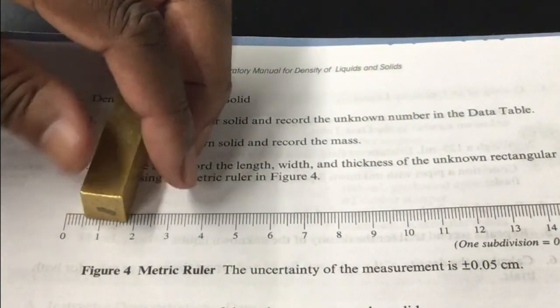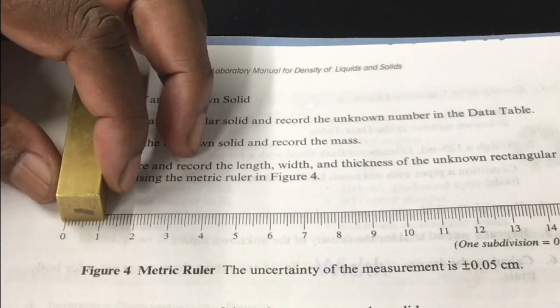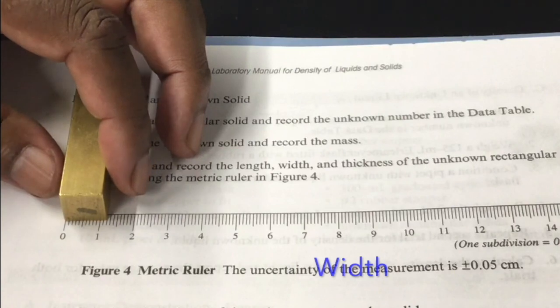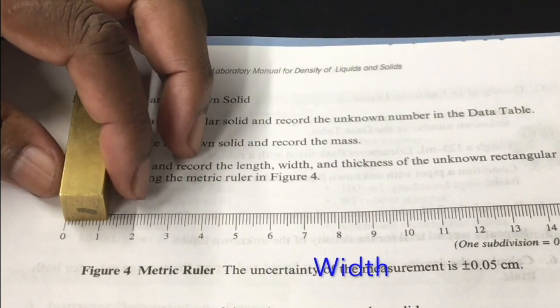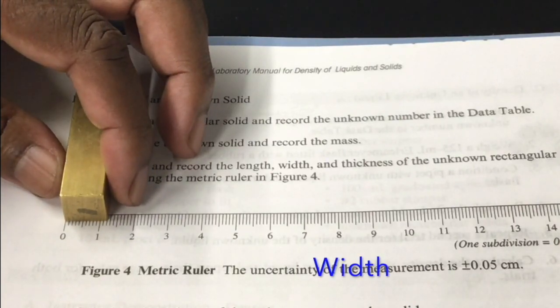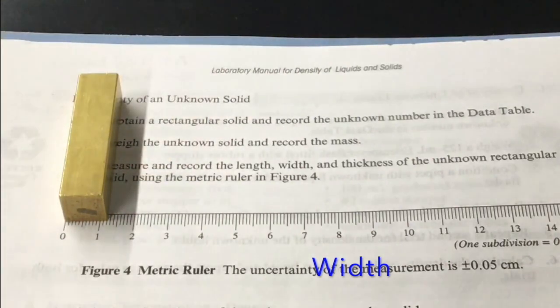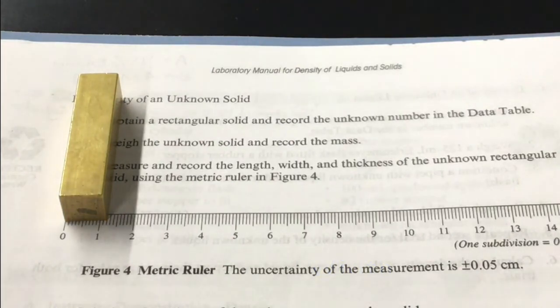The width, I don't know if it's the same thing. That's going to give you the same value for volume. You know, volume by calculation: length times width times the thickness. Please record the thickness as well. All right. I know there is a shadow, but hope you are able to see the thickness.